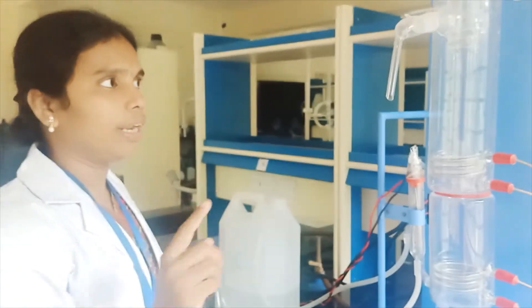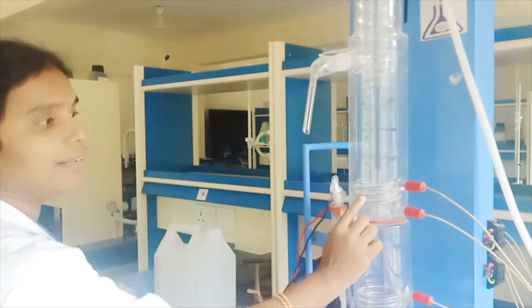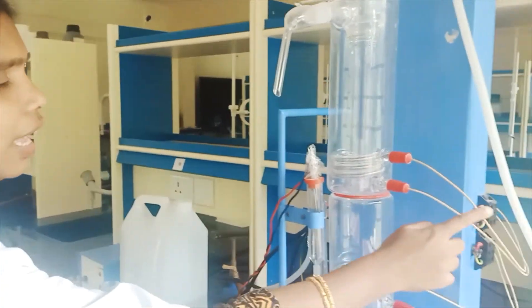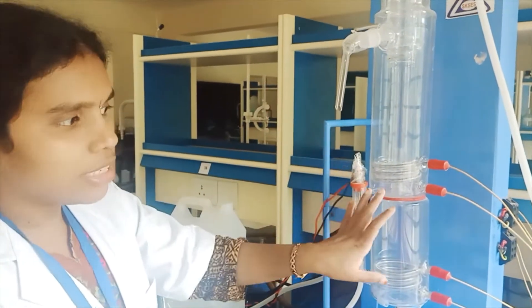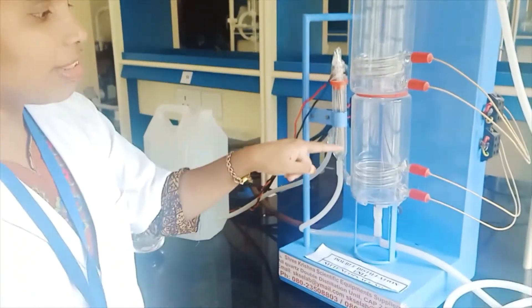One is the inlet and one is the outlet. Inside there is a heating coil — you can see the heating coil here, connected with the electrical circuit. I am giving a demo for you: when you turn on the tap, water will be circulated inside.